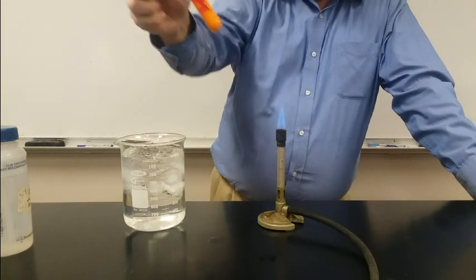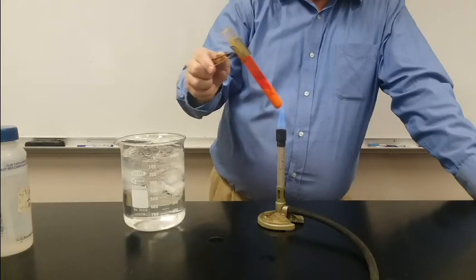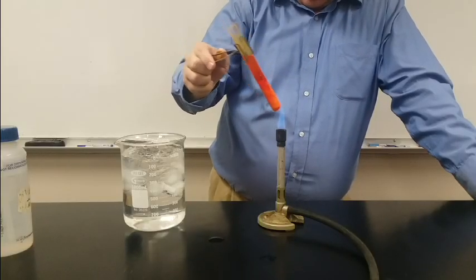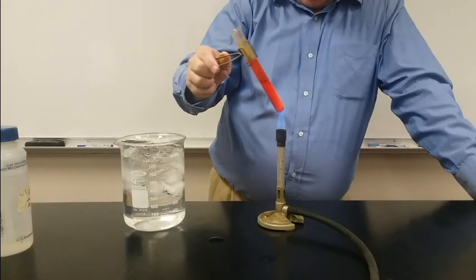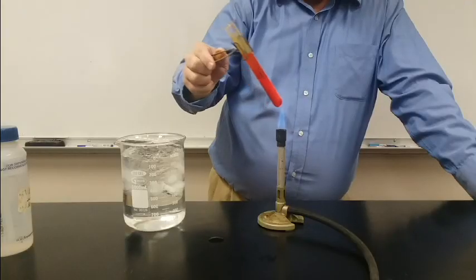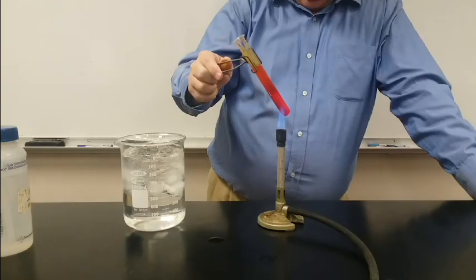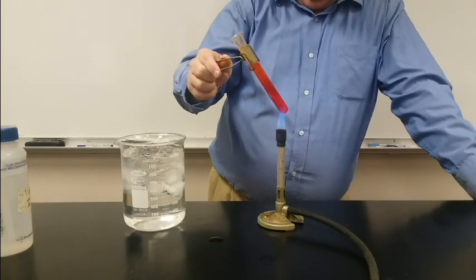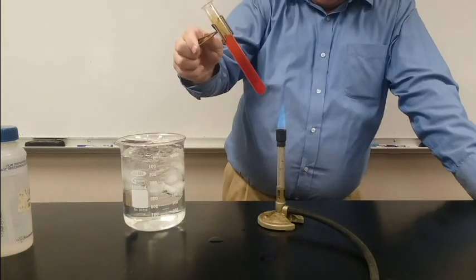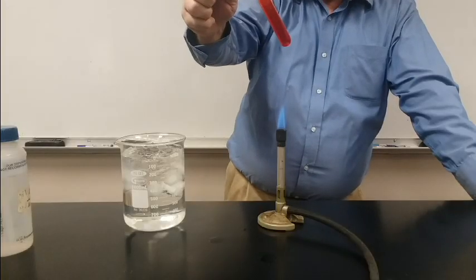I can just reverse this process by heating it up again. If I heat it up again, the solid goes right back into solution. You can just watch that solid disappear. So in the end, for solids, increasing temperature increases solubility, and decreasing temperature decreases solubility.